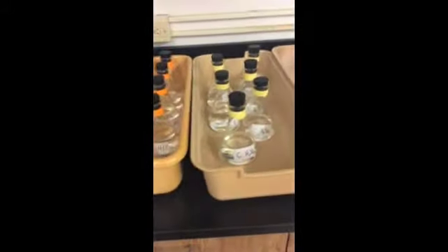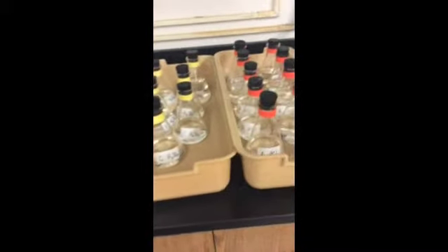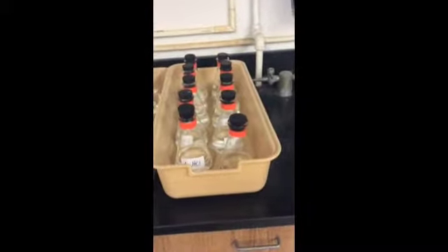This process was done for 3 different acids, 2 of which were hydrochloric and the last sulfuric acid. Each time a new acid was used, the color of the tape switched.